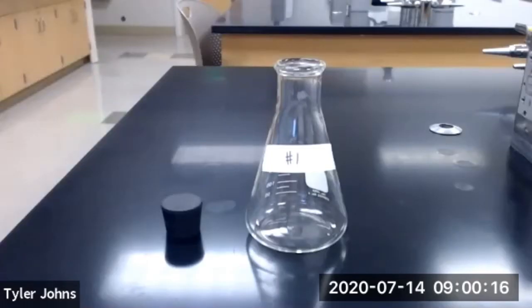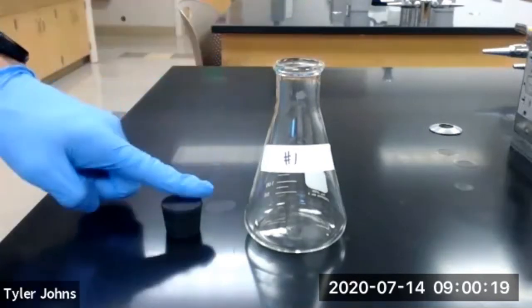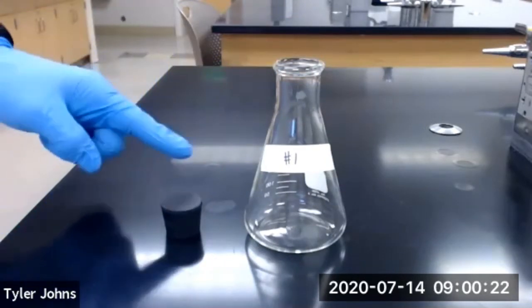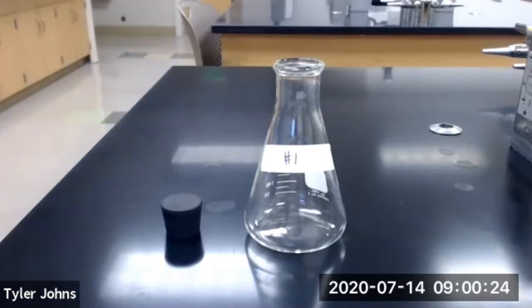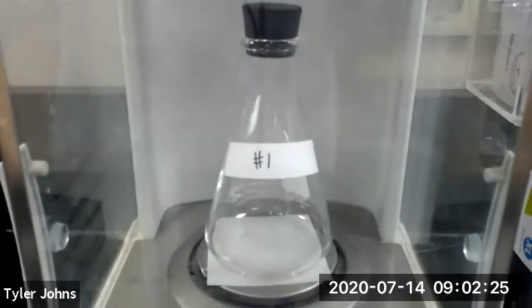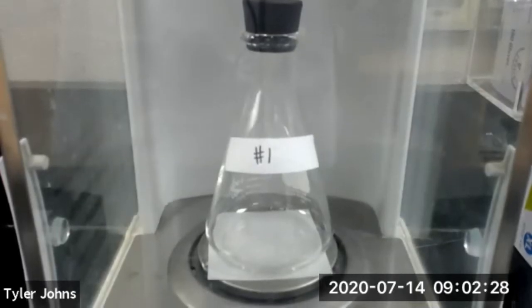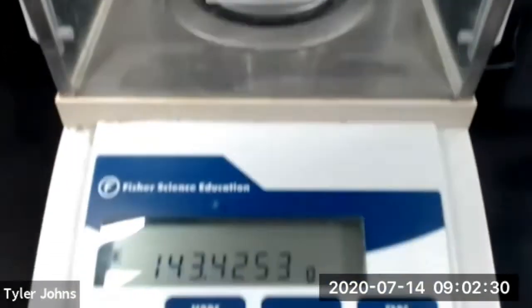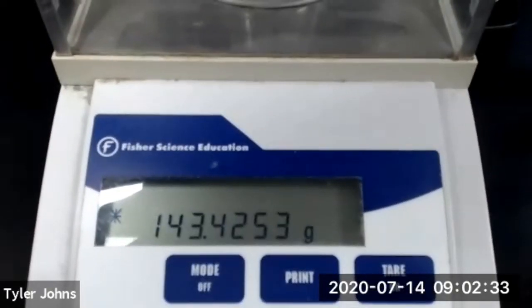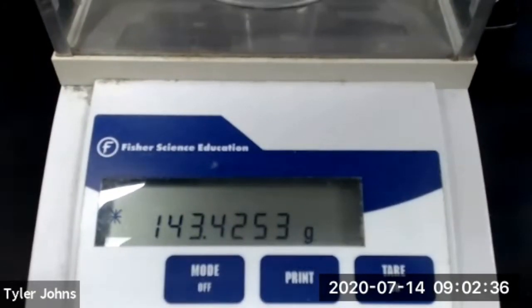We first need to obtain a clean 250 mL Erlenmeyer flask and stopper, and we will now determine the mass of our flask, stopper, and the air inside the flask. The mass of our flask, stopper, and air inside the flask for trial number one is 143.4253 grams.